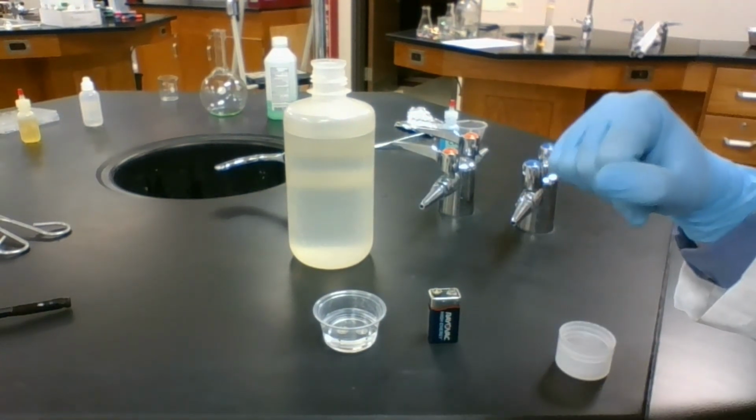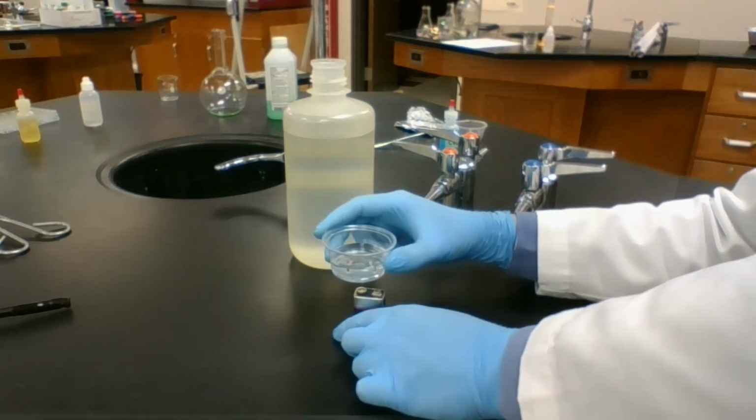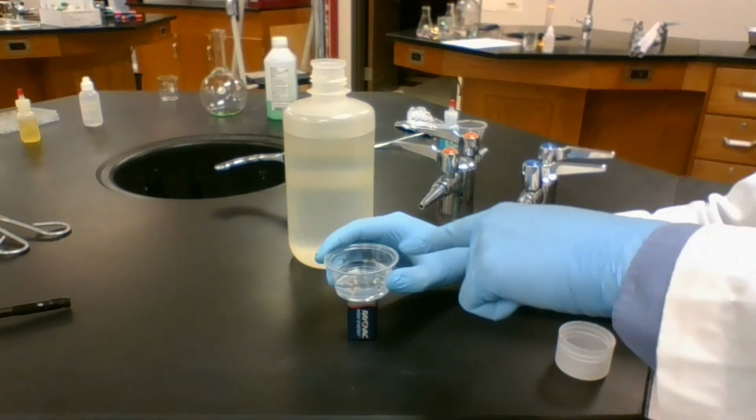Now, water alone doesn't actually conduct electricity that well. We get electricity to conduct through water with minerals, with salt and other ions that are floating around in there. So in this case, we're using salt water to just help conduct that electricity. The salt does nothing to the reaction itself. So by giving a little bit of energy to the water that's in here through means of this battery, we get a reaction here.